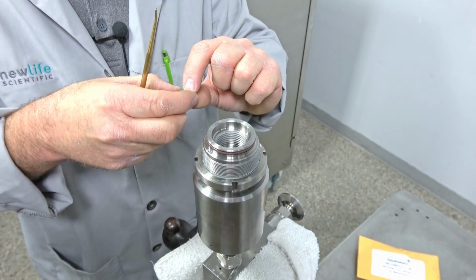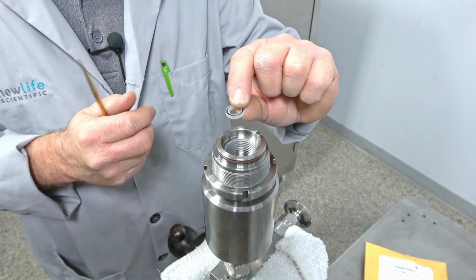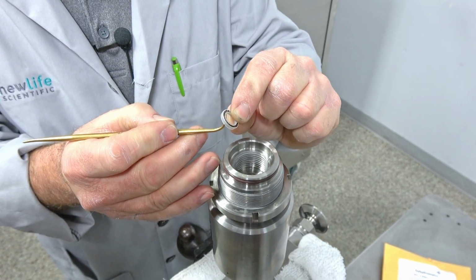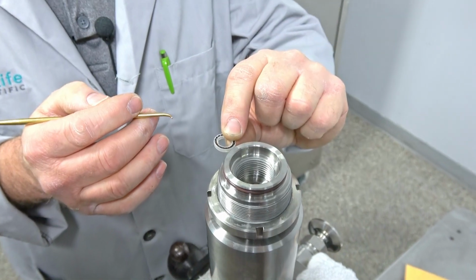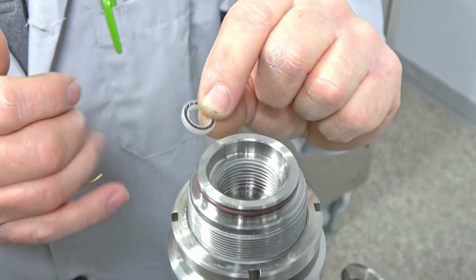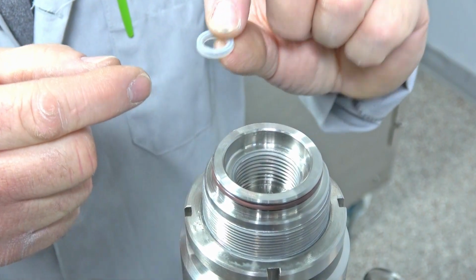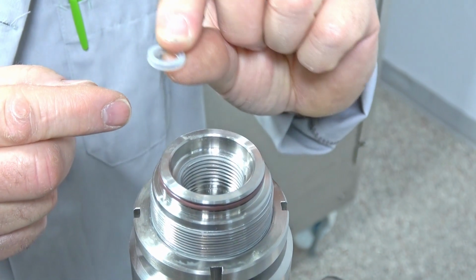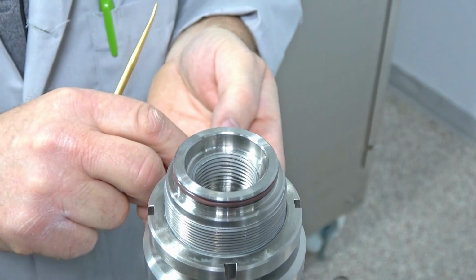Now, just to let you know, if you put it in upside down, it fits in there real easy, because this is tapered, and it looks like, hey, you put it in that way, it fits in real easy, but that's not the right way. You have to fit it in where this is this way. So that might help you to remember.